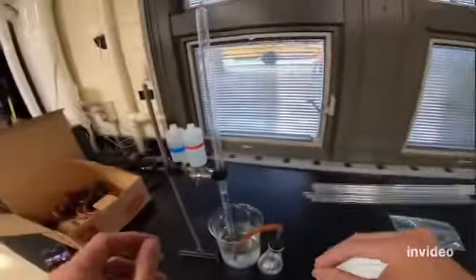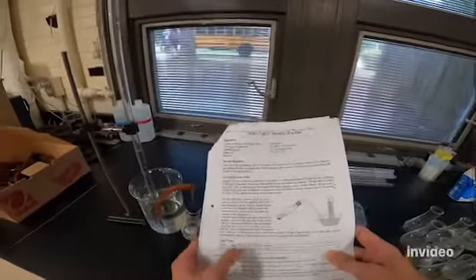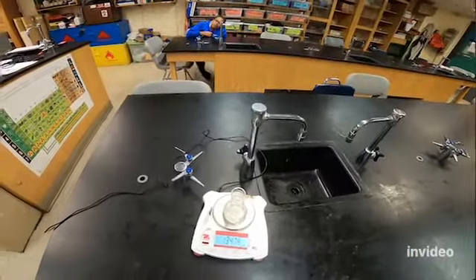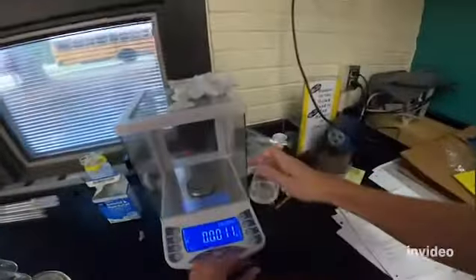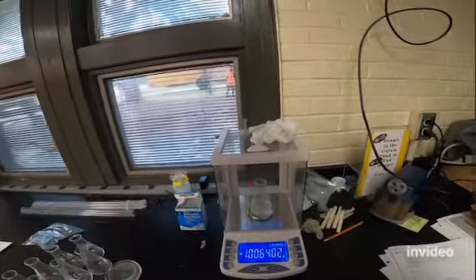I'm gonna stop. And so what I would do here is, so before I took the flask, the water, and the Alka-Seltzer tablet, now the Alka-Seltzer tablet is dissolved in here and the gas escaped. So I'm going to take my flask. I can record the mass over here on this scale again. You probably won't notice much of a change on this scale. I actually don't remember what it was before because I didn't write it down. And then I'm going to bring it over to the analytical balance. And I'll record that mass as well.